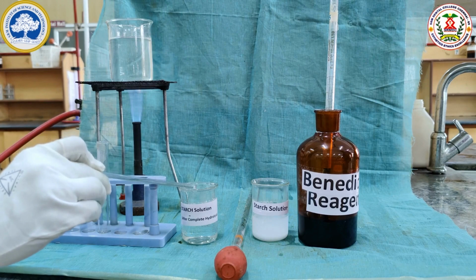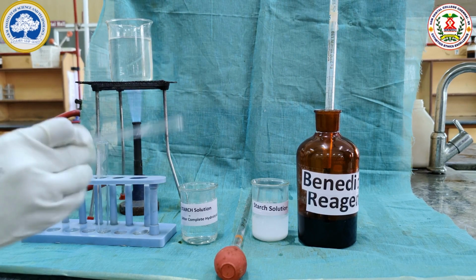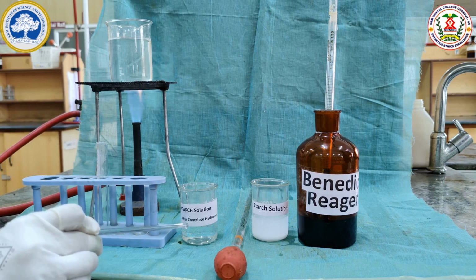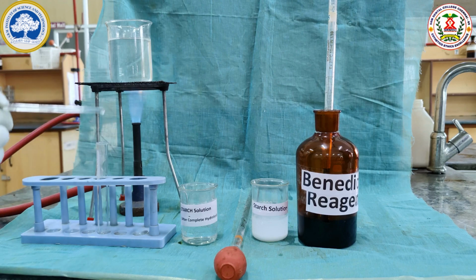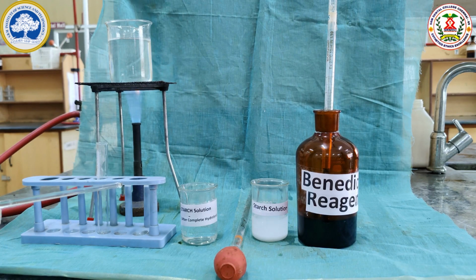This is completely hydrolyzed starch solution after complete hydrolysis of 1 hour. So now the starch has been converted completely to glucose. Now we are going to neutralize the solution and we are going to do the Benedict's test and the Seliwanoff's test to prove that starch is a homopolysaccharide of glucose. That is, the monosaccharide present in the starch is only glucose.